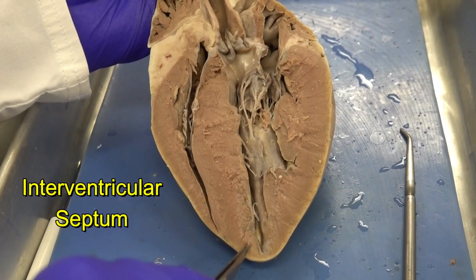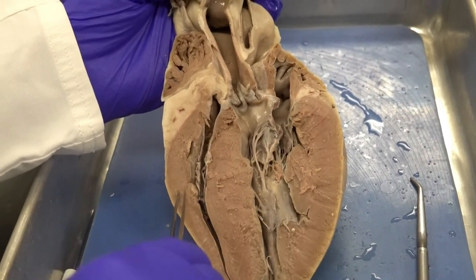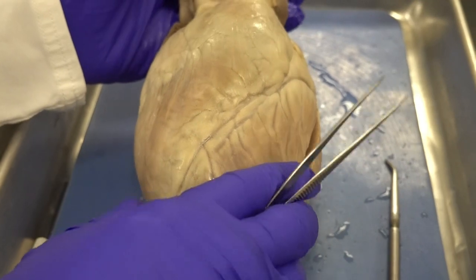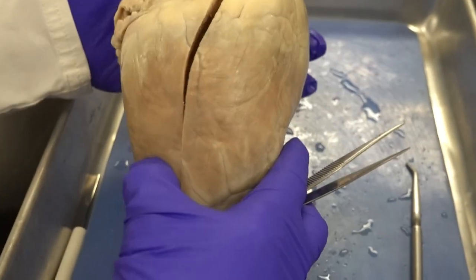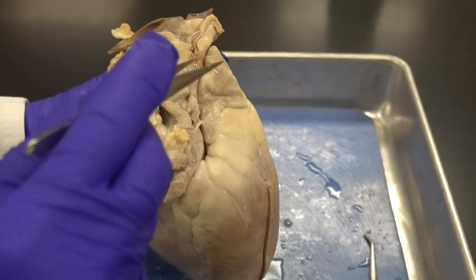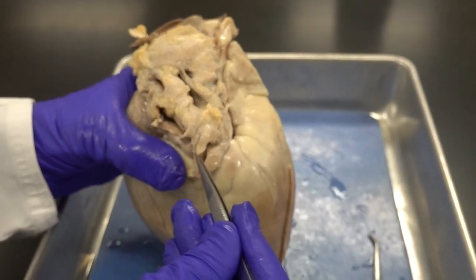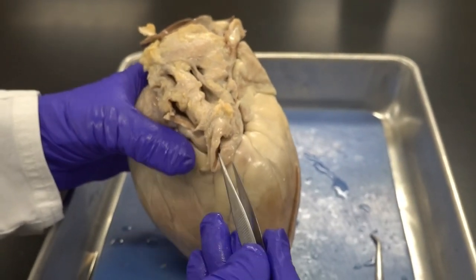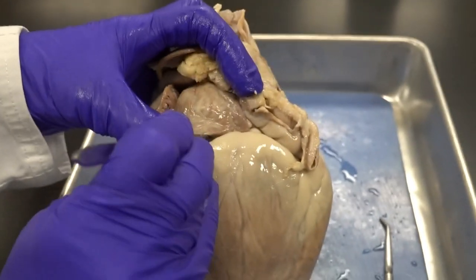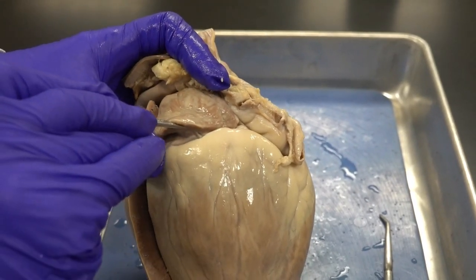This is the interventricular septum — note its thickness as it separates the two ventricles. Regarding the three veins that send deoxygenated blood into the right atrium: the superior vena cava, the inferior vena cava, and the coronary sinus, which is found deep inside the coronary sulcus.